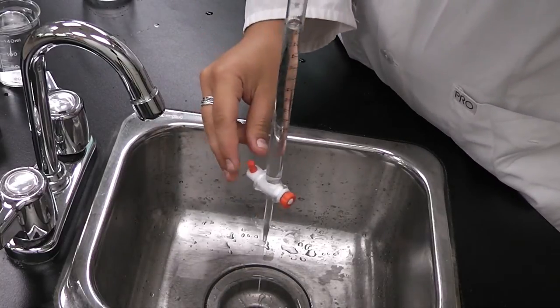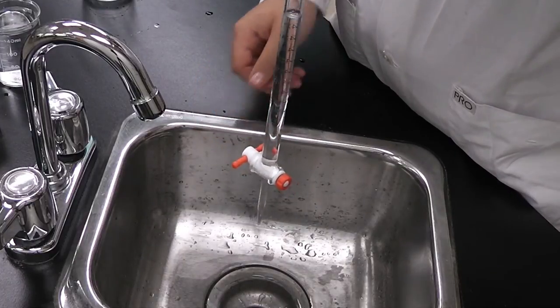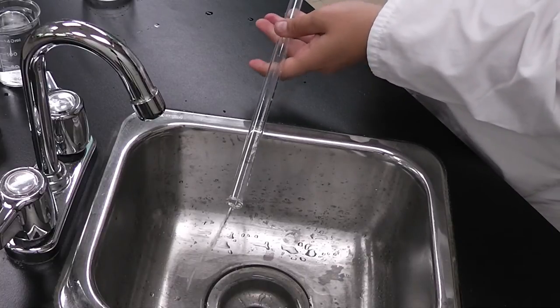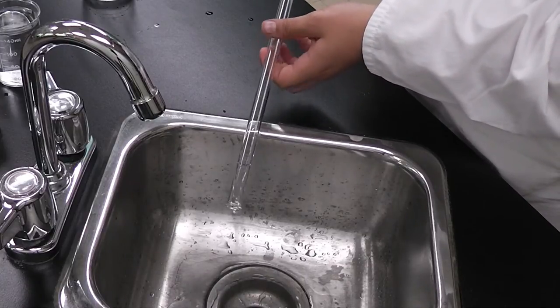Let approximately half of that water drain, close the stopcock, and pour the rest into the sink by rotating the burette, thus coating the inside.